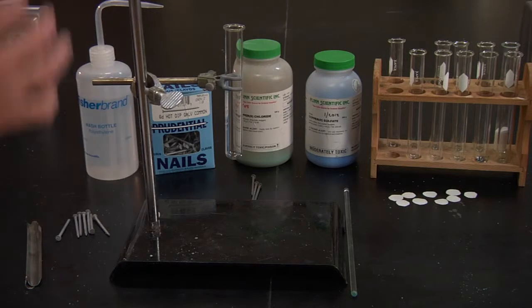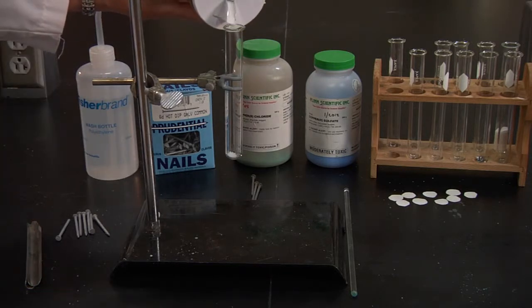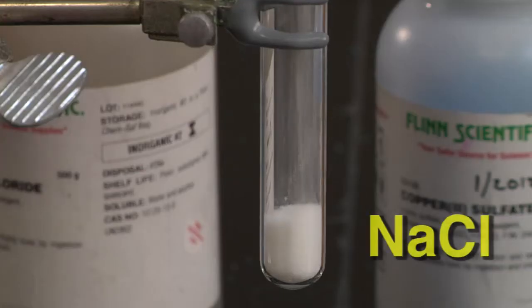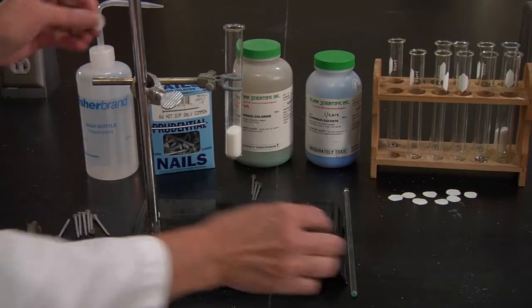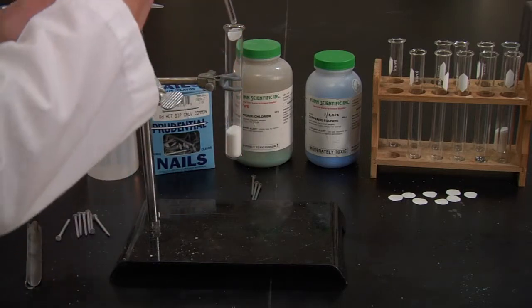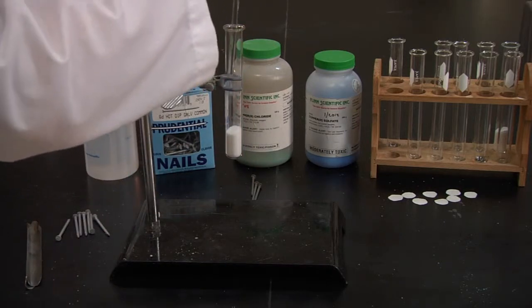I'm going to pour in some sodium chloride. I'm going to take a piece of filter paper and put it in the test tube. This is just to slow the reaction down a little bit.